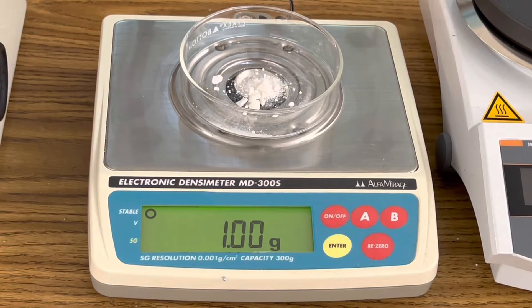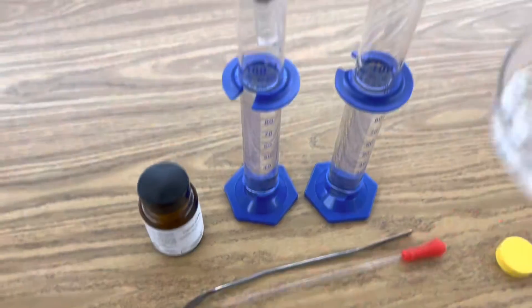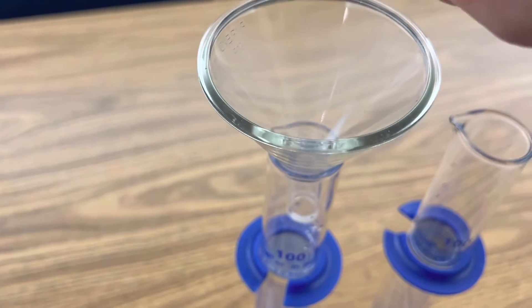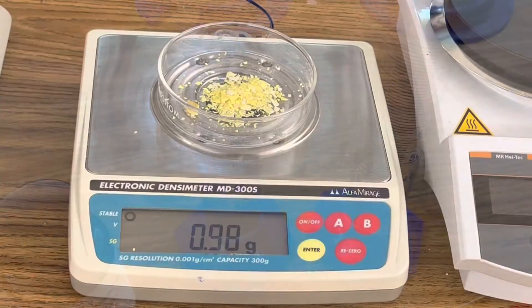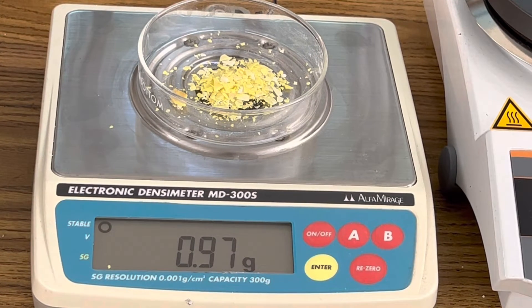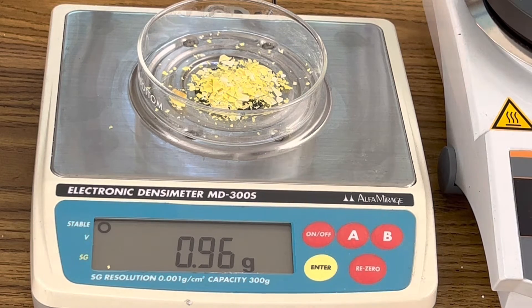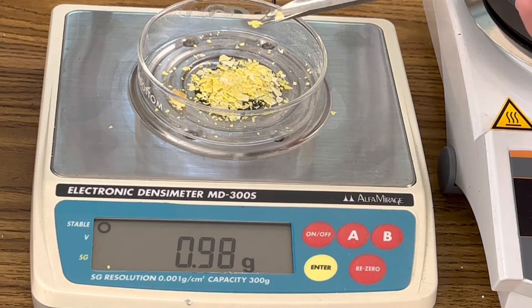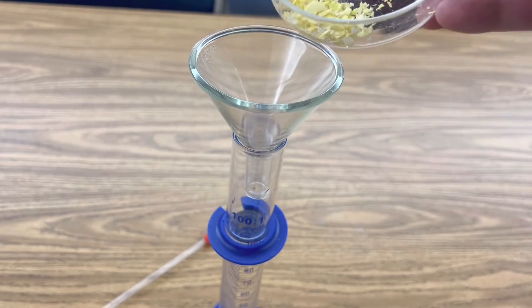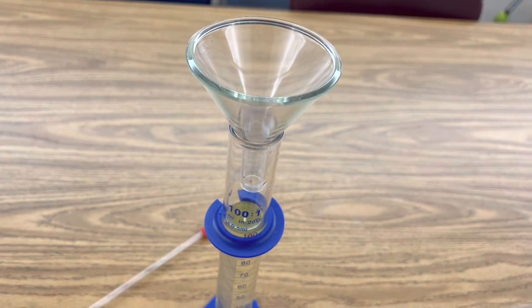Begin by measuring one gram of cadmium chloride. Next measure out a gram of sodium sulfide. Now add your sodium sulfide to your second graduated cylinder of 100 milliliters of distilled water and stir that solution until it's completely aqueous.